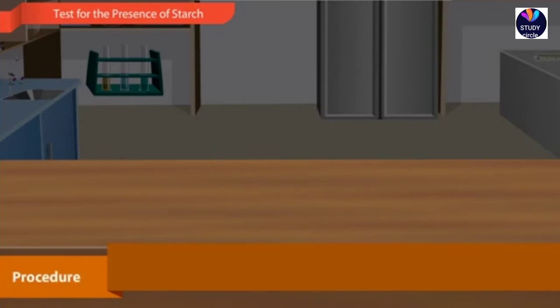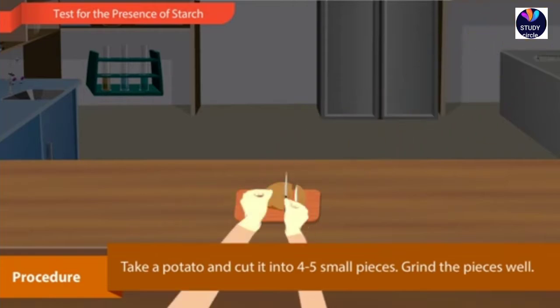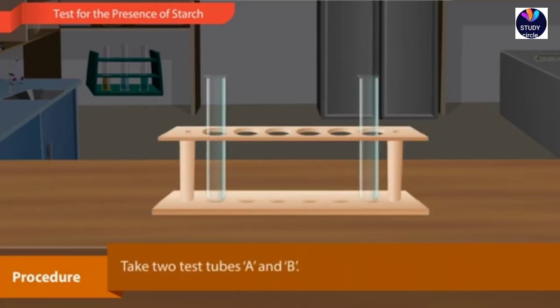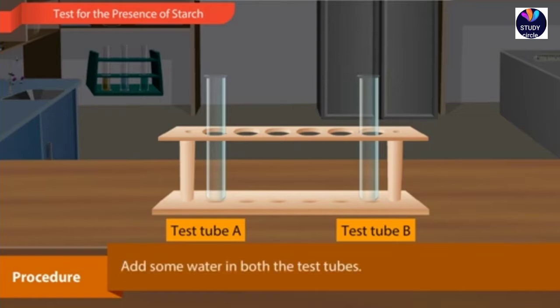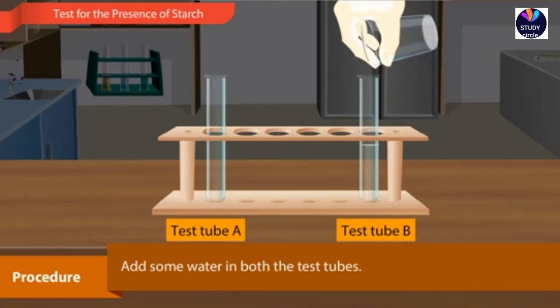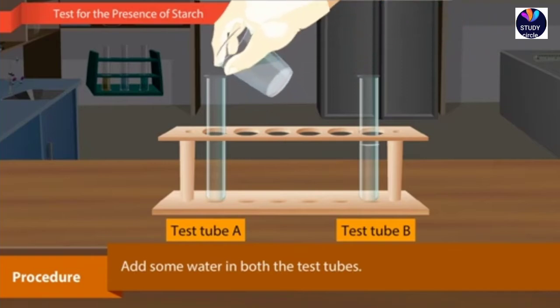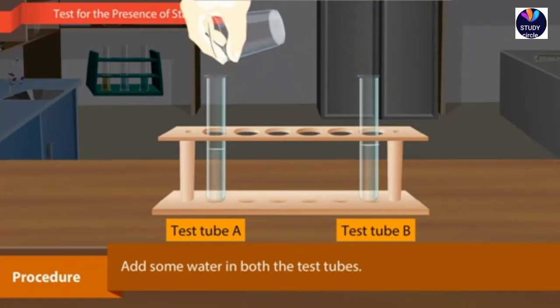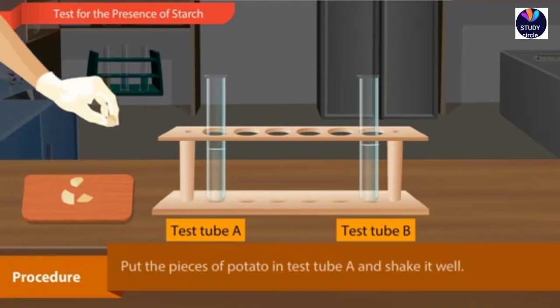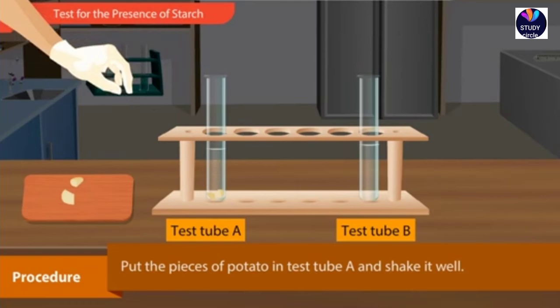Procedure. Take a potato and cut it into 4 to 5 small pieces. Grind the pieces well. Take 2 test tubes, A and B. Add some water in both the test tubes. Put the pieces of potato in test tube A and shake it well.